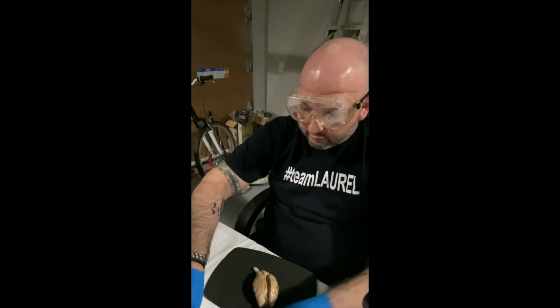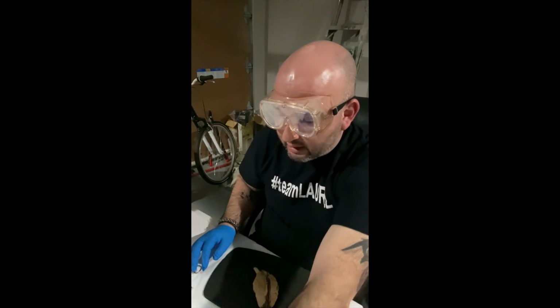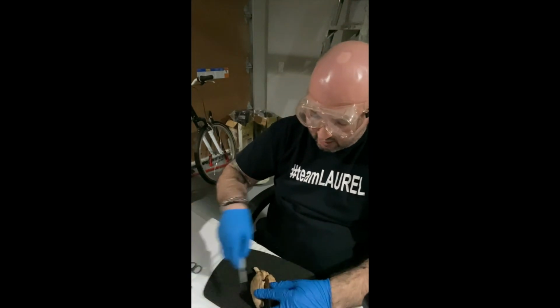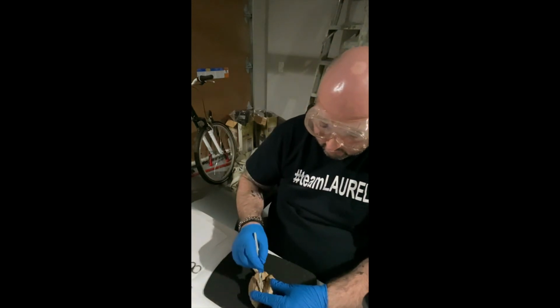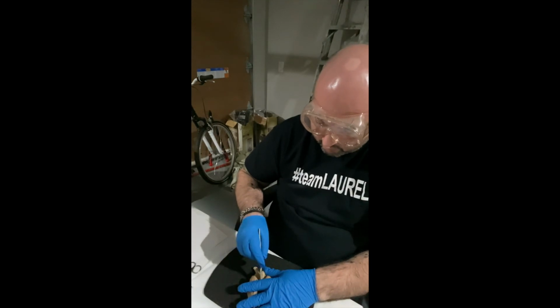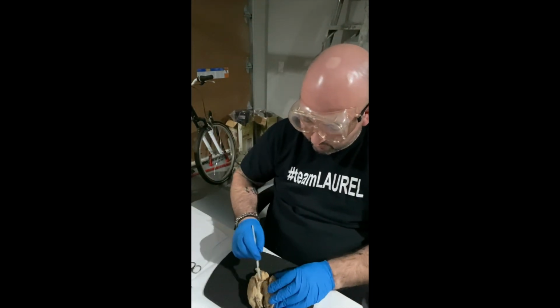All right, so now I'm going to go ahead and proceed, and I'm going to cut the sheep brain at the corpus callosum. So basically just down the center so we can get a sagittal view and again go through some more anatomy. And this is just my scalpel very efficiently cutting through the sheep's brain.